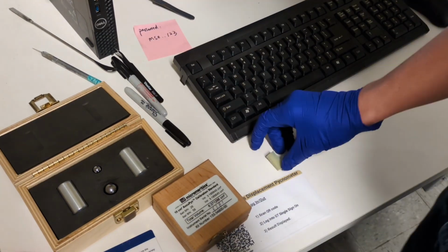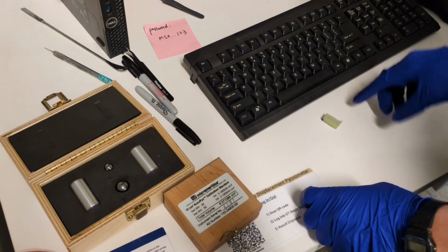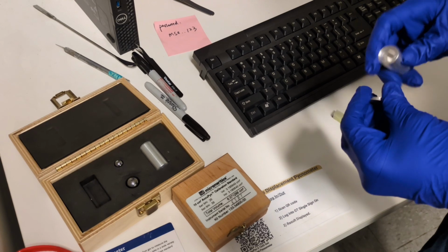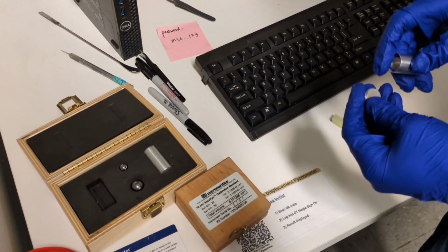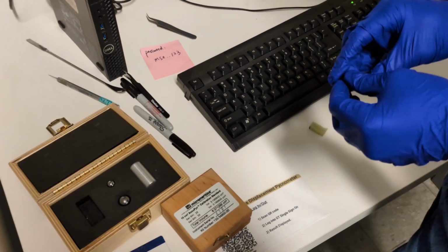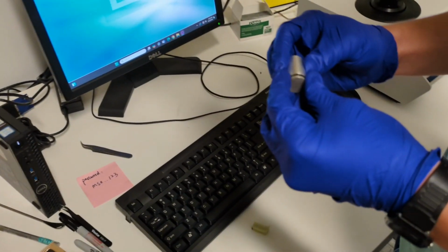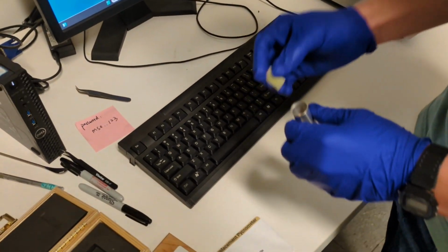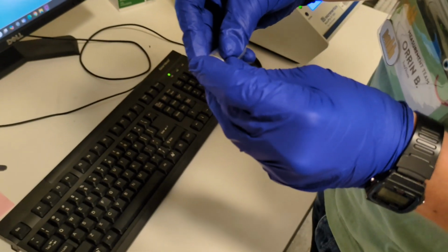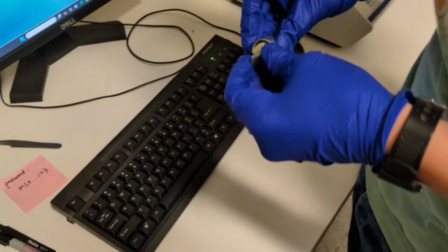So we want to choose one of those that will best fit our sample, because the accuracy and precision of the machine is based on the total size of the sample container. So we want to fit our sample to the smallest container it can fit in to make our results as reproducible as possible. So we will probably want to use this one. The foam will have to be compressed slightly to fit in there, but as long as we're not trying to measure porosity, that shouldn't affect its absolute density.